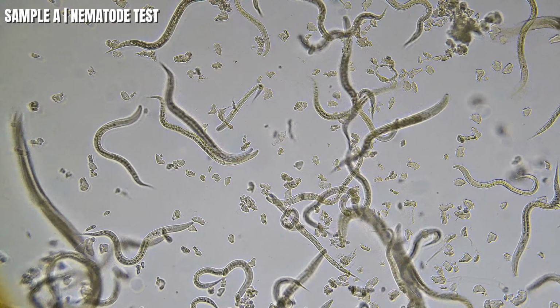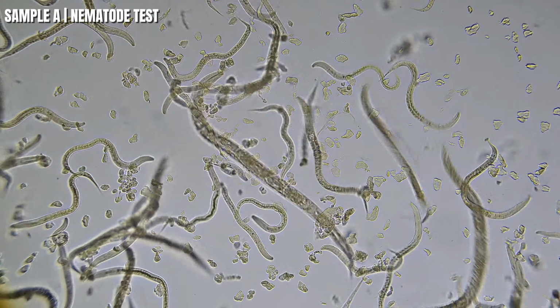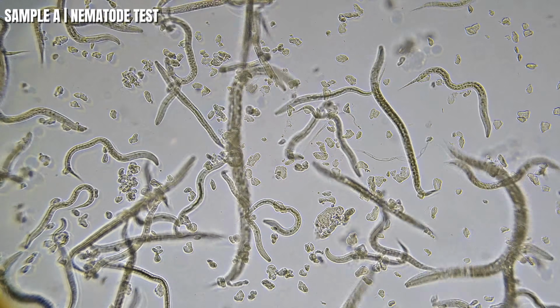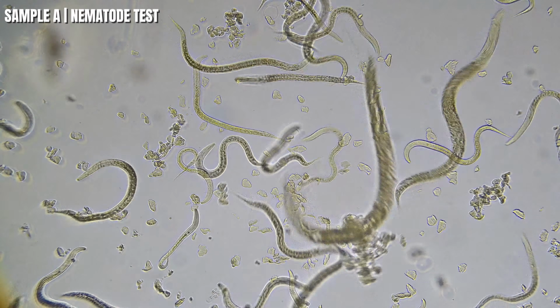So I zoomed in a little bit to get a closer look to see what's going on inside. So you can see the adults, the eggs inside of them right there, which they reproduce very fast, like I told you. And so it looks like they're slowing up. Did you guys notice that? Of course, right? They got 10,000 gallons of sample A whiskey poured on them. So I think if I would have had that done to me, I'd be out.